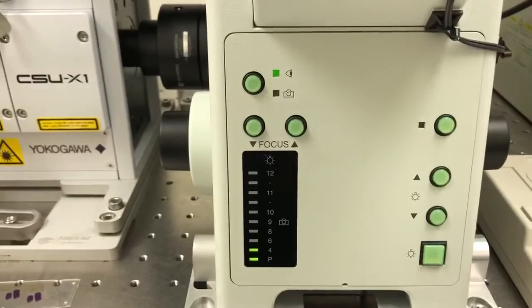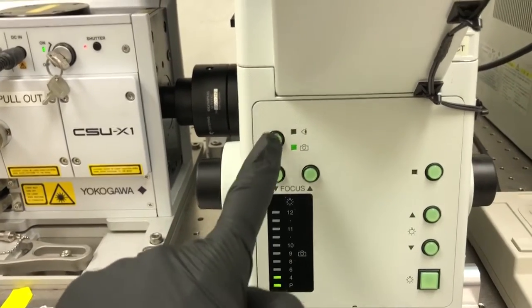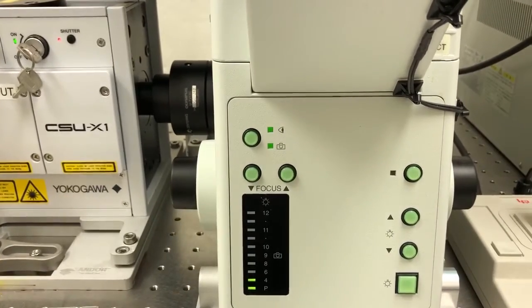If instead we want the light to go to the left, to the cameras on this system, we would press the button again and send it to the cameras. That's not what we want to do, so we want to go back to eyes.